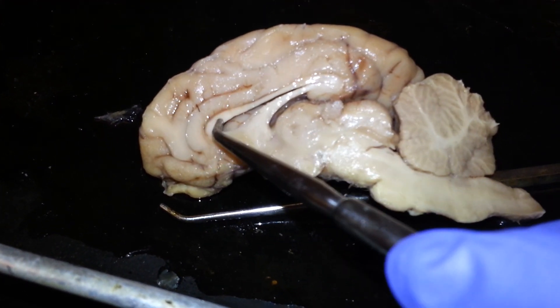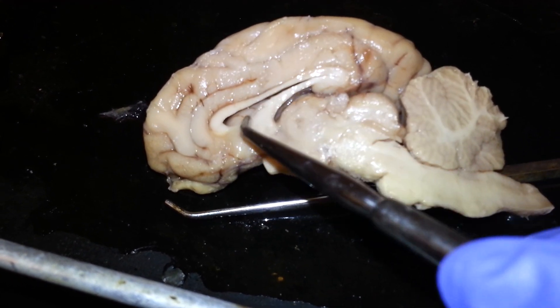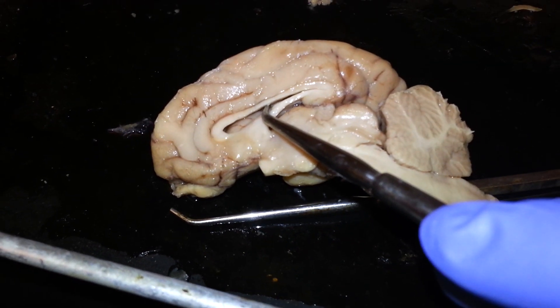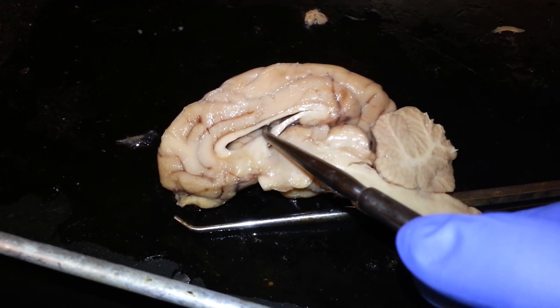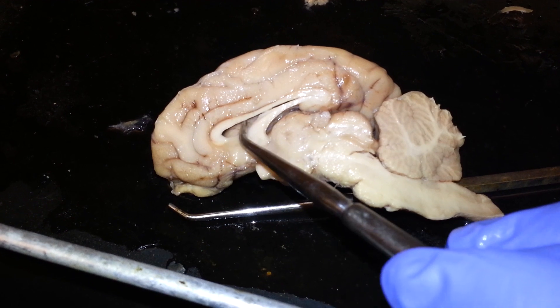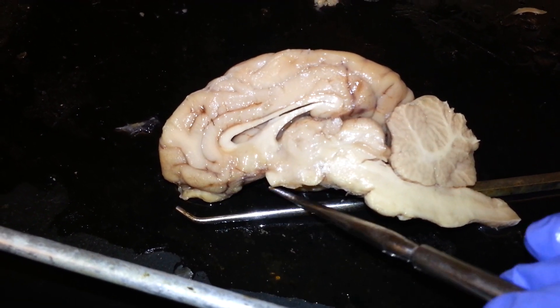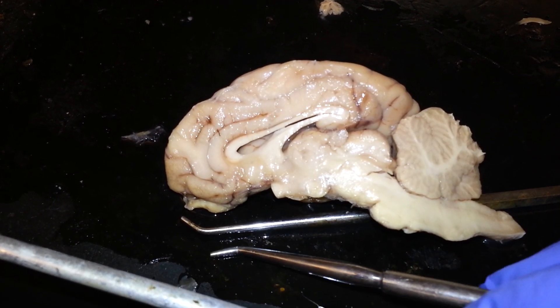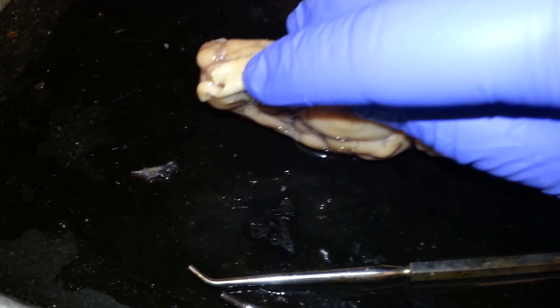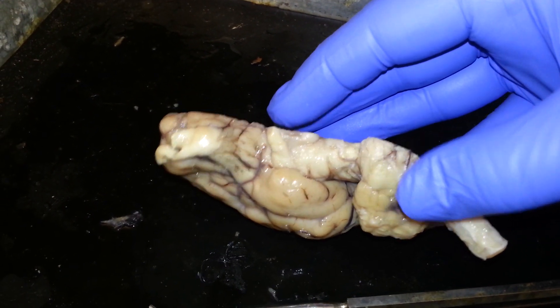Above this white tissue here — what would be the ceiling of the room that I'm pushing on — that is the corpus callosum, and that would be the ceiling of the room. C, corpus callosum — C, ceiling. And then we have the olfactory bulb underneath the brain, or inferior to.